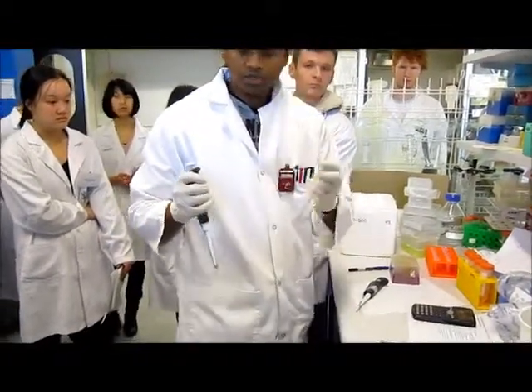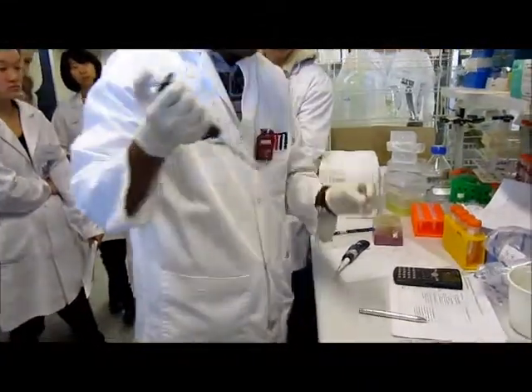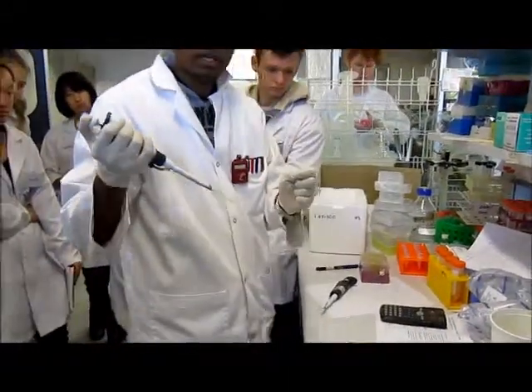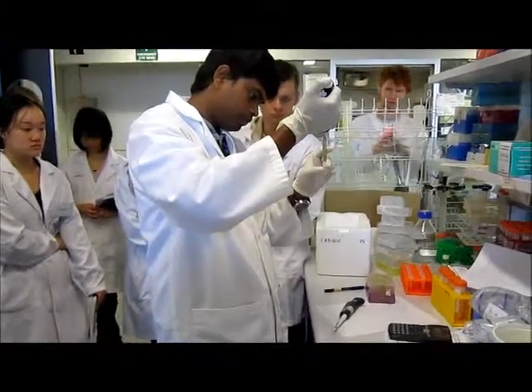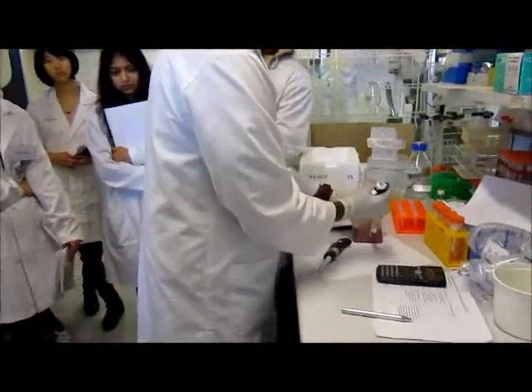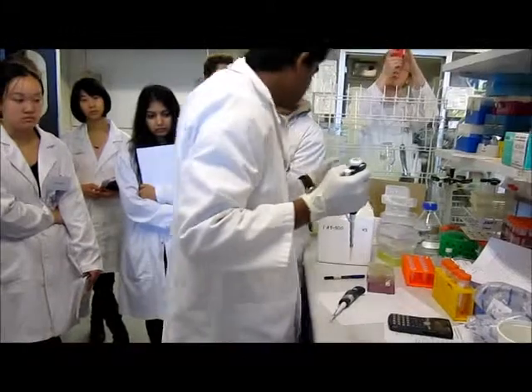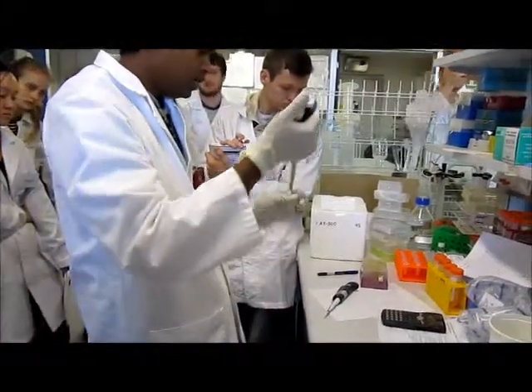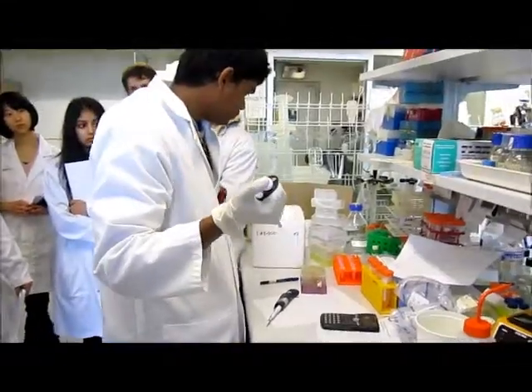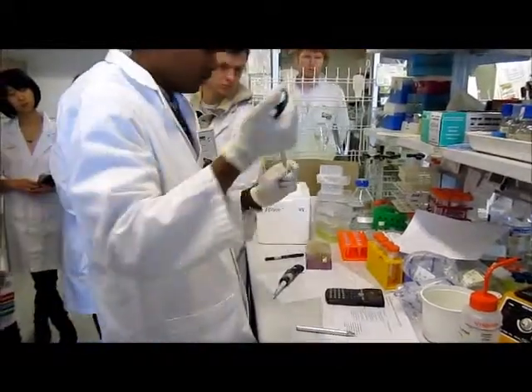This is our RGD plasmid. PMK RGD. This one is B221. Here.